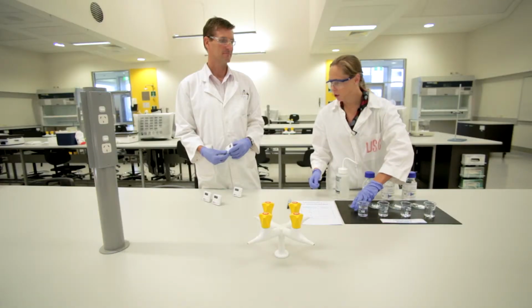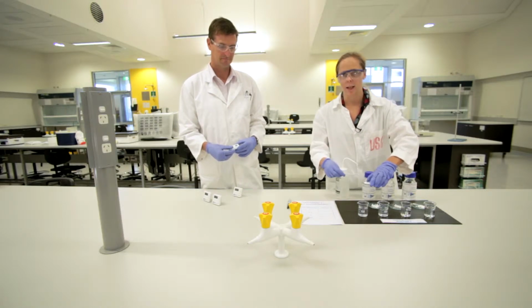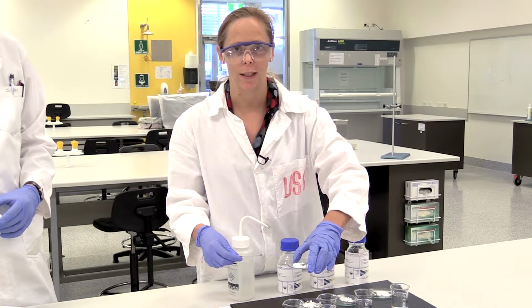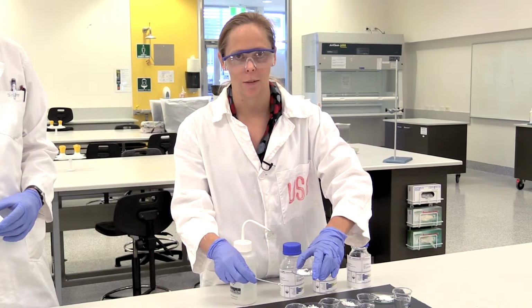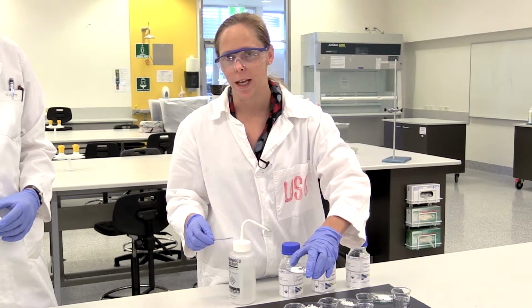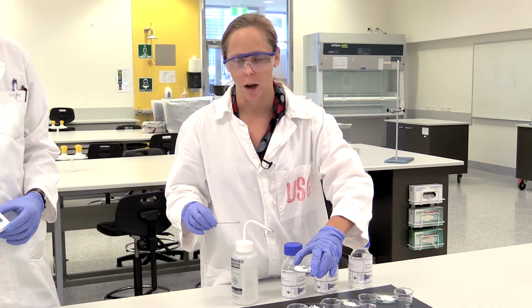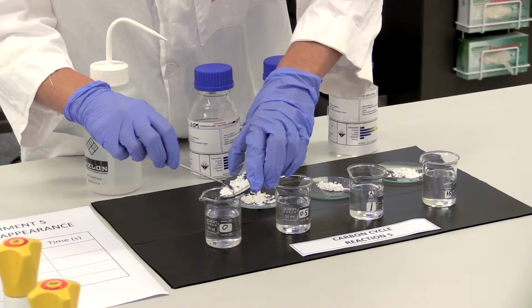So my assistant Scott here is going to start the timer when I add the calcium carbonate to the hydrochloric acid. What we'll end up with is calcium chloride, which is soluble in water, whereas calcium carbonate is insoluble. The calcium carbonate will eventually become soluble calcium chloride in the hydrochloric acid, and the time it takes will be the end of the reaction, and then we'll stop the timer. Okay, so this is for the 0.5 one. We're going to start now.